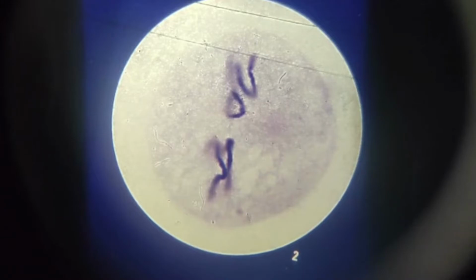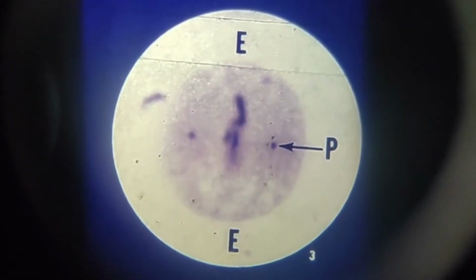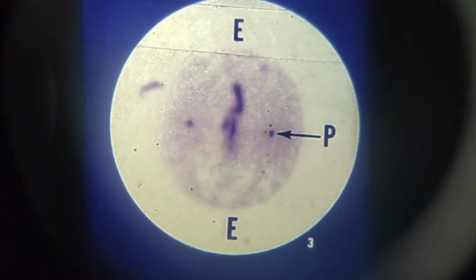In these slides, we shall refer to these chromosomes as the U-shaped and the bent. The sperm supplied 1 U-shaped and 1 bent chromosome. The other U-shaped and bent chromosomes came from the egg cell. After fertilization, the 2 U-shaped ones pair up, as do the 2 bent chromosomes. After a while, the 2 pairs begin to move towards the equatorial plate. At this stage, or slide, this is now the metaphase.